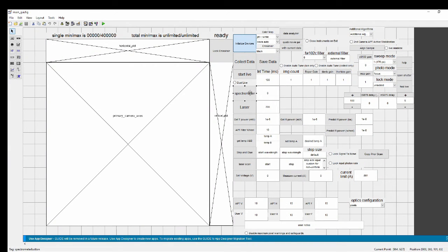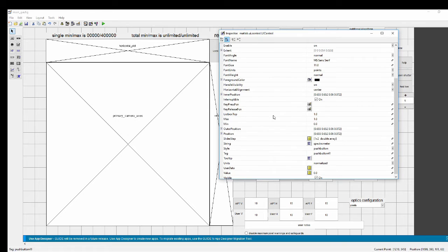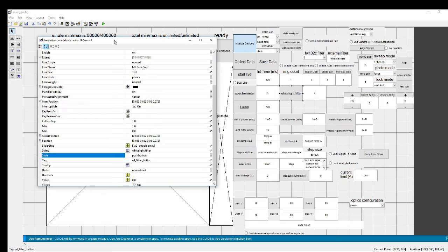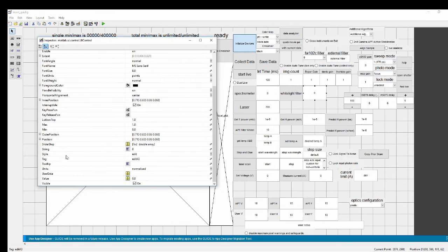Alright, so now what I'm envisioning is two buttons just like this to the right of it. And in order to work with the code I've already written ahead of time, we got to make sure we put correct tags on them. Alright, so the tag for this one, I have that it should be white light filter button. And the string should probably be something like white light filter. Does that actually fit? It's a little crowded, but it just barely fits. And then this one should have a tag of white light filter input.